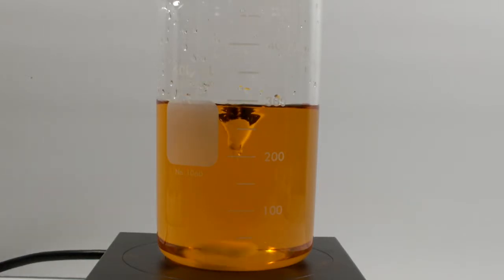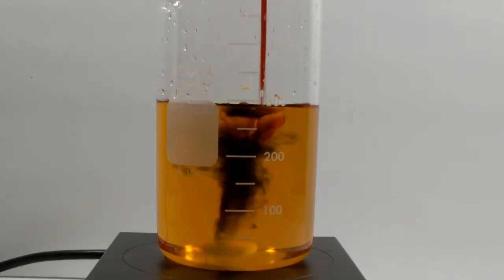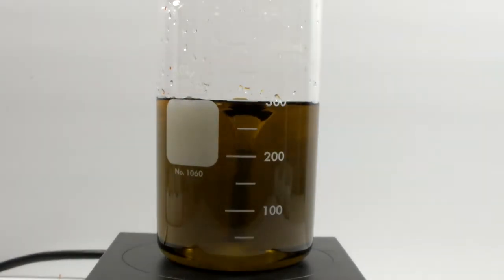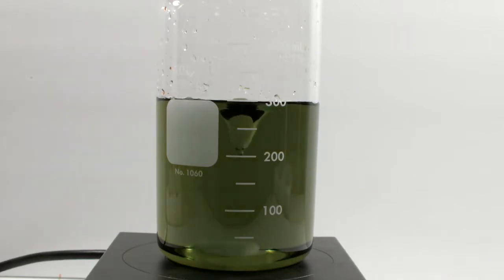The 6 milliliters of ferroin are up now. Remember, ferroin is colored blue in an oxidizing environment and red in a reducing environment. With the sulfuric acid and the cerium 4 present, this is an oxidizing environment, and the change to blue is exactly what we'd hope for here. Given that this is an oscillating reaction, we're hoping for obvious and repeating color changes. As the cerium 4 is reduced, it becomes colorless, so we're left with only the blue color of the ferroin.